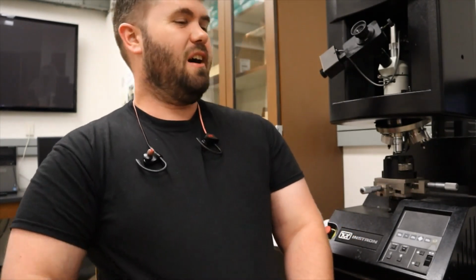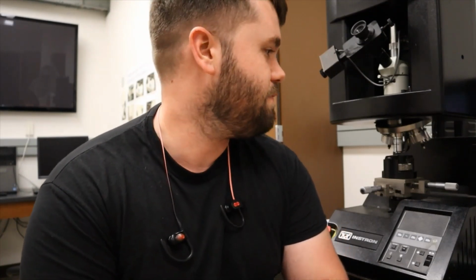This sample's pretty messed up, so I can't really tell what the microstructure is, but in the regular lab, the samples would be polished ahead of time, and telling the microstructure is relatively easy. In the actual lab when we did it, we would take hardness tests on, as I mentioned, a pure copper sample, an alpha sample, which is copper and silver, but mostly copper, a eutectic sample, remember, which is layered alpha and beta, a beta sample, which is silver and copper, but mostly silver, and then a pure silver sample. And you compare all those Knoop hardness values to each other.